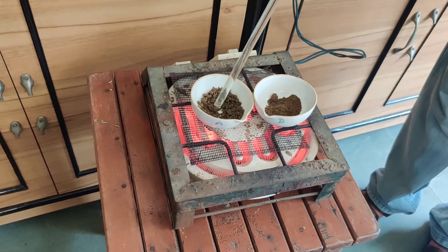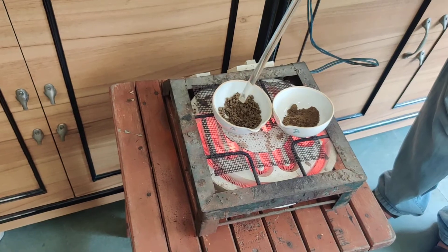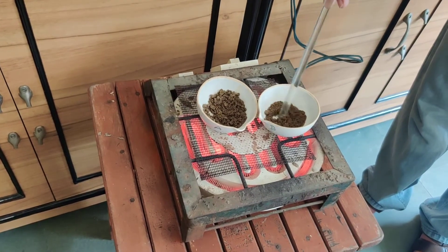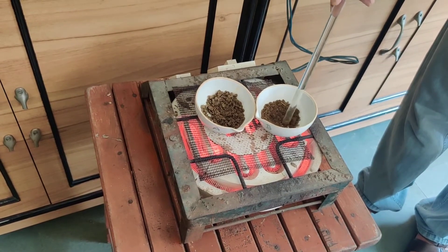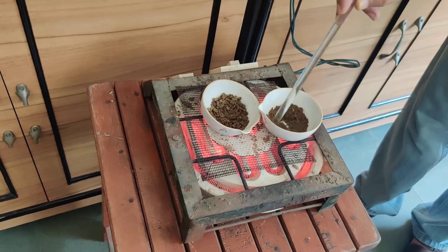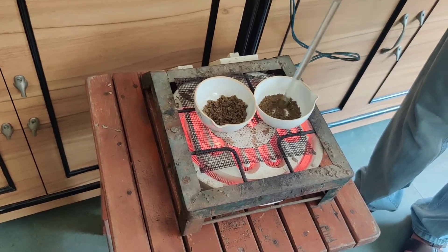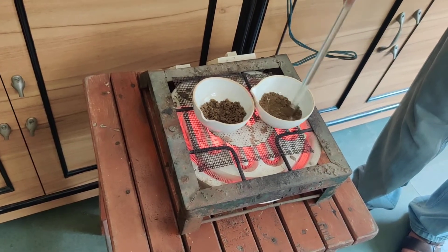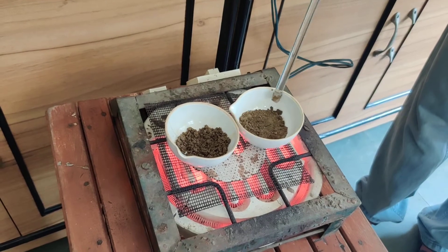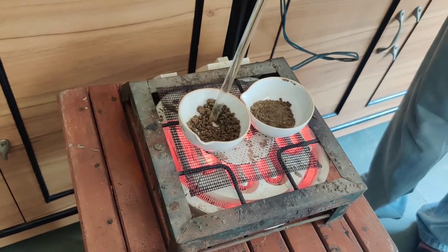You should repeat the process — after making it dry, take its weight, dry it again, and again take the weight. You will repeat the process until the weight becomes constant. We have to do it very carefully. Make it dry so it will begin to dry. Water is evaporating from this sample and from this sample also. Water is going to evaporate and soil is becoming dry.